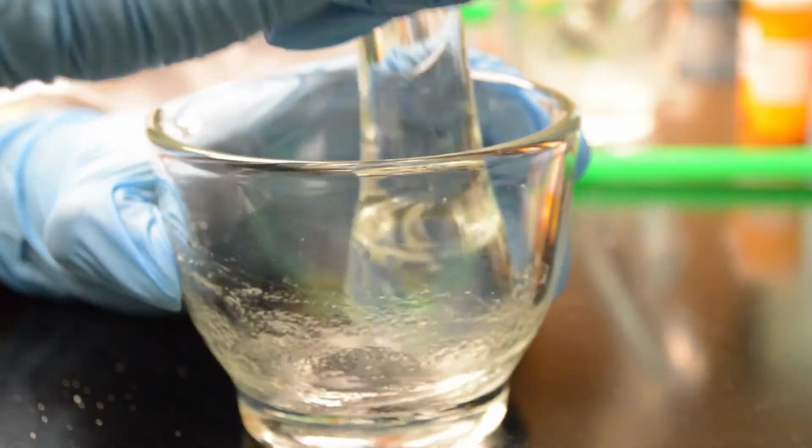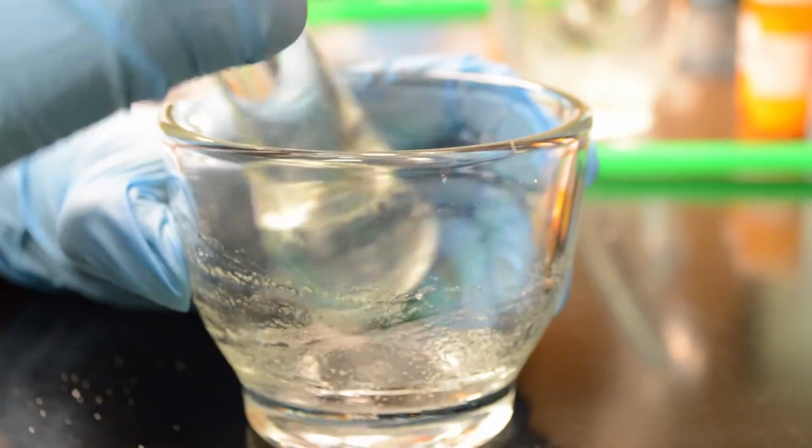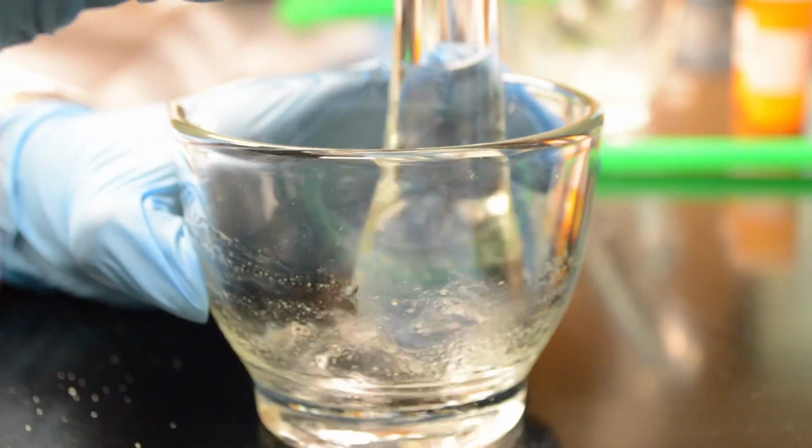Essentially it is the intimate mixing of two or more ingredients by forceful combination. Some of the key terms that are used are forceful and intimate mixing of two or more ingredients that will result in a mixture that has a melting point lower than the individual components and lower than room temperature.